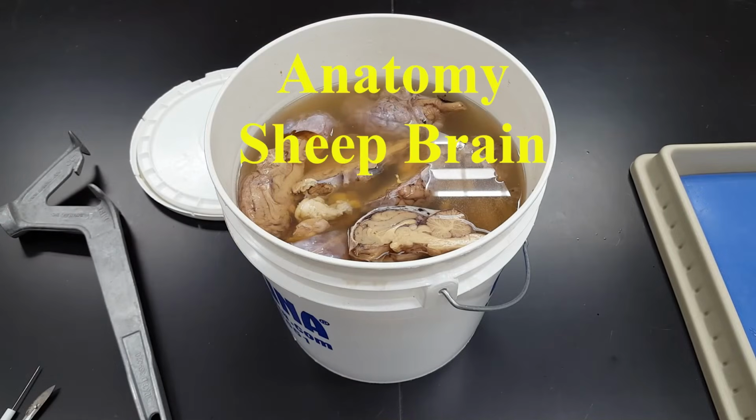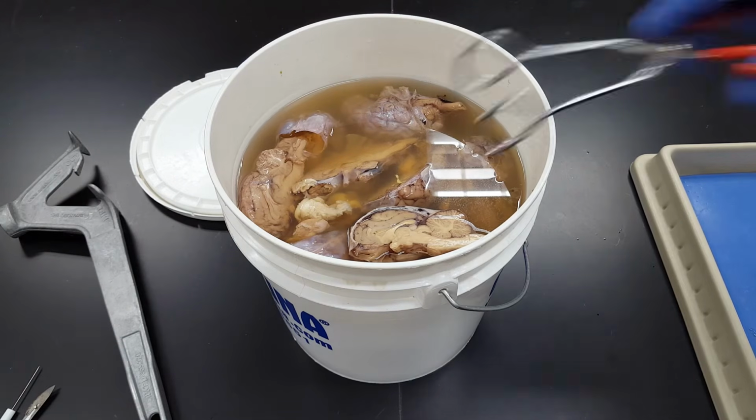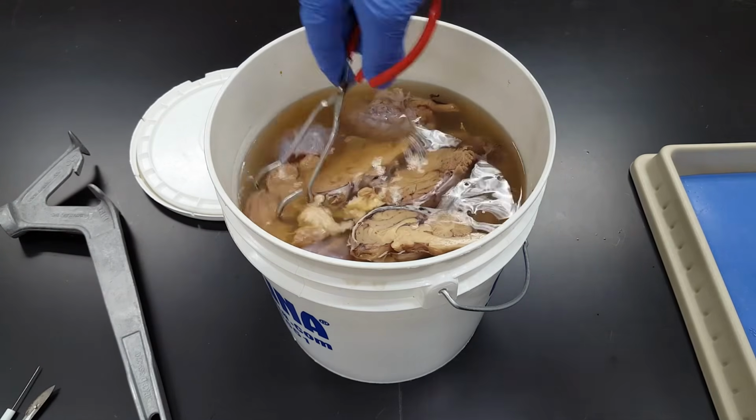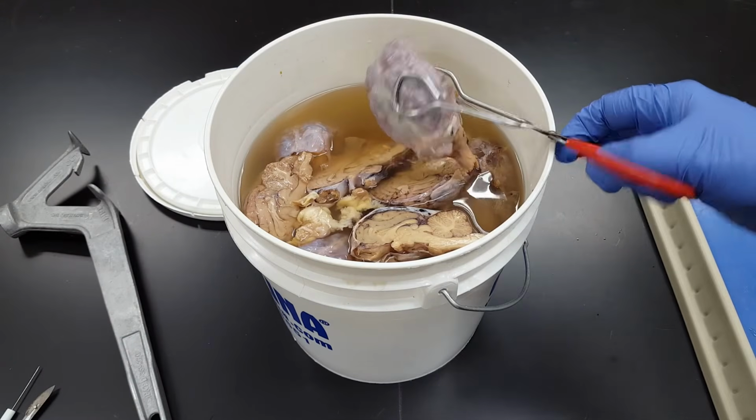What we have here, obviously, a bucket o' brains. And who does not have a bucket of brains laying around? I know that I do. You probably do too at home. And I have some brains that you can see have already been dissected, and a few, here's a nice one right here that has not.